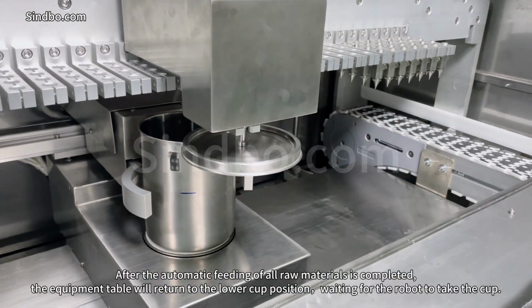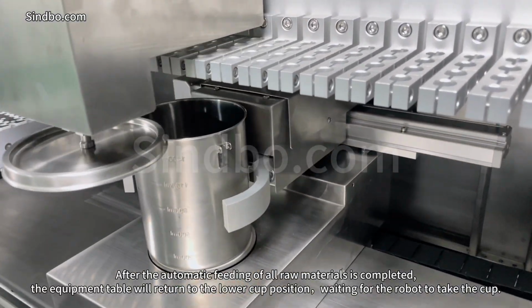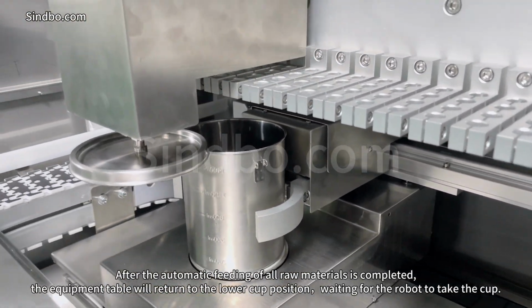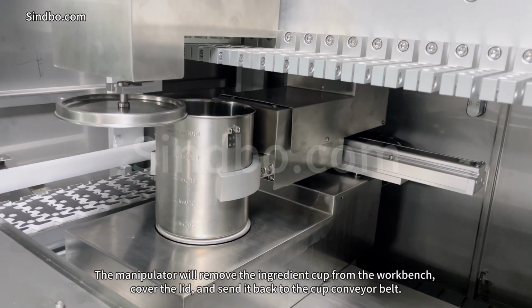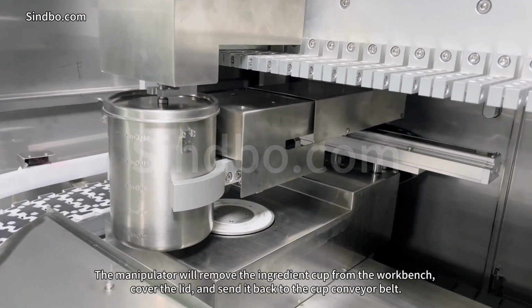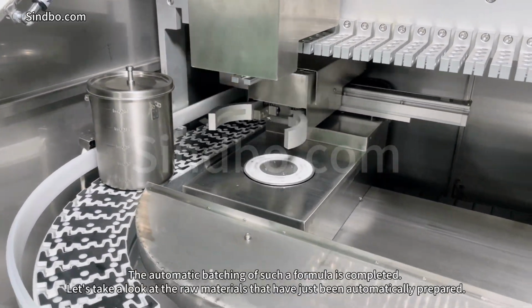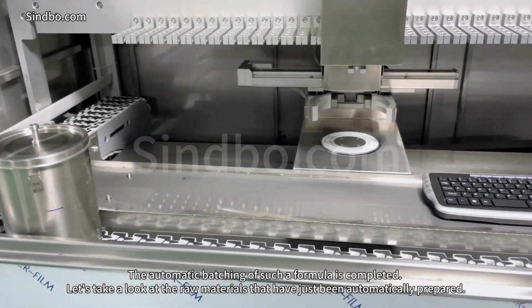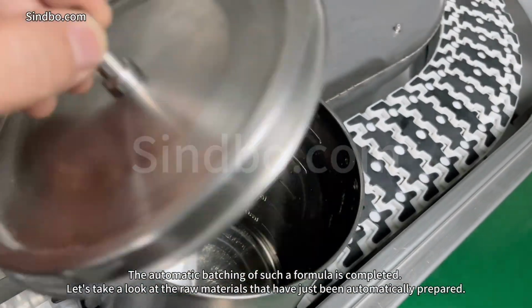After the automatic feeding of all raw materials is completed, the equipment table will return to the lower cup position, waiting for the robot to take the cup. The manipulator will remove the ingredient cup from the workbench, cover the lid, and send it back to the cup conveyor belt. The automatic batching of such a formula is completed. Let's take a look at the raw materials that have just been automatically prepared.